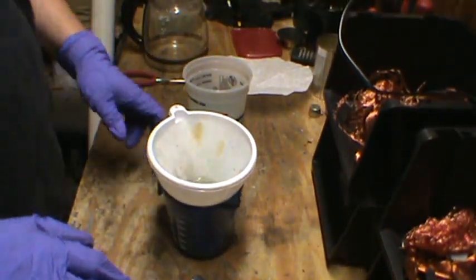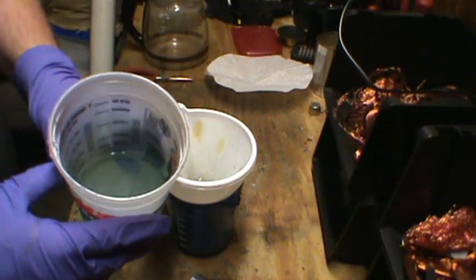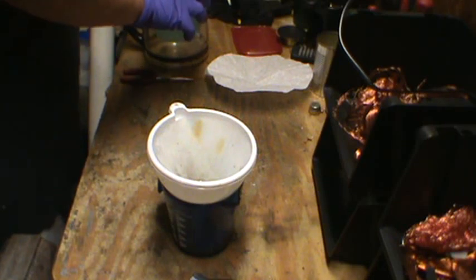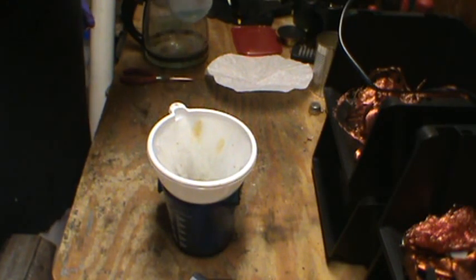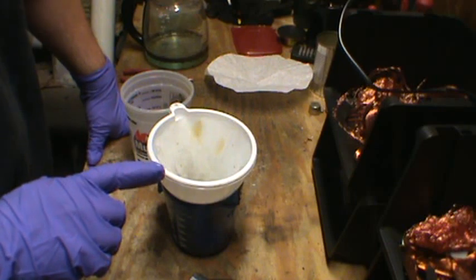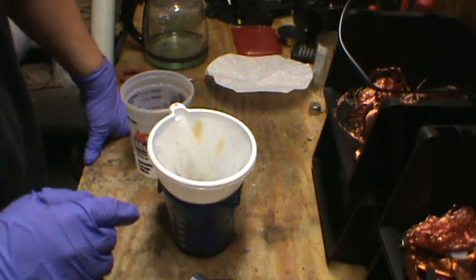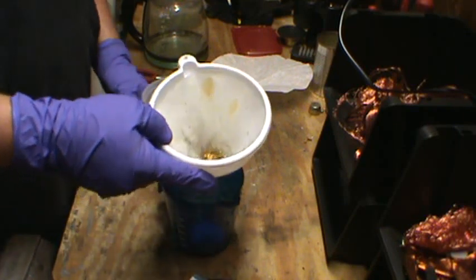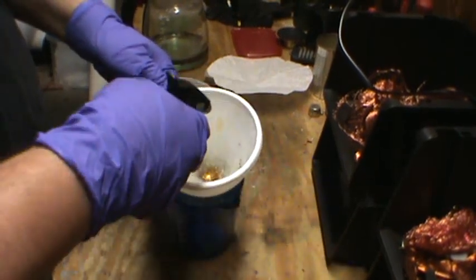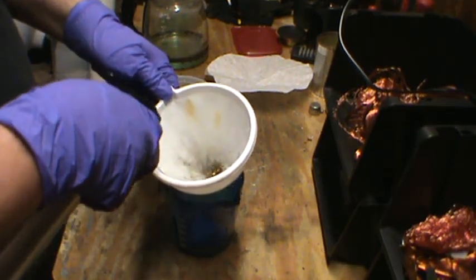Best practice — you see how this water is a little bit blue? That's because there's still copper in there. What you want to do is run your foils through the muriatic acid again to help get rid of any other copper that might be on there. And then rinse it well with water to dilute any remaining acid that may be on it.